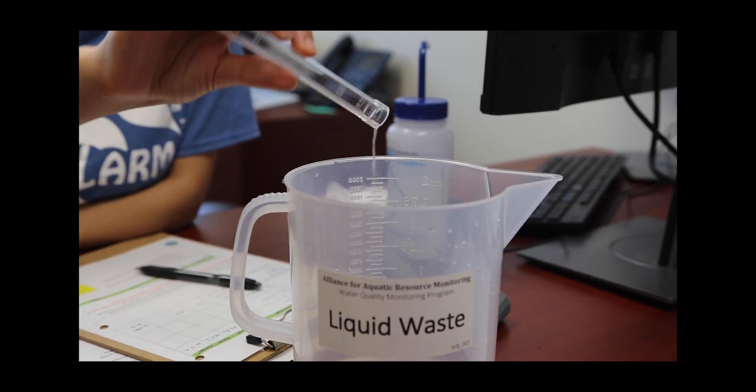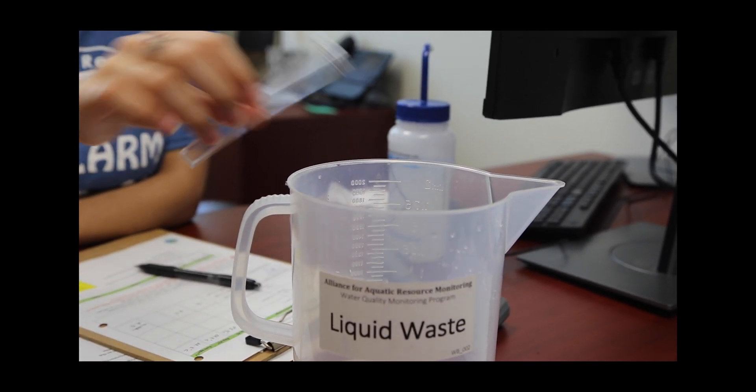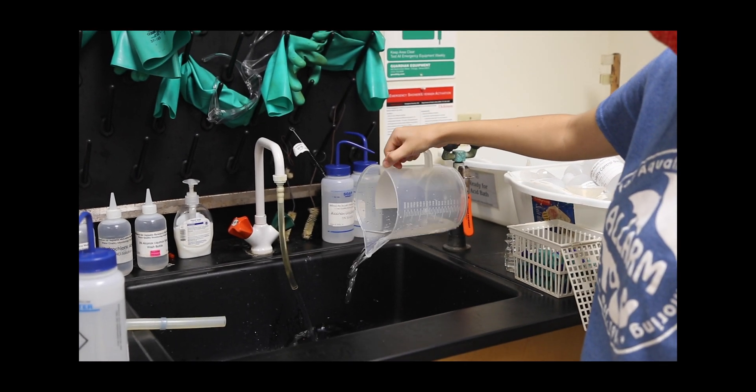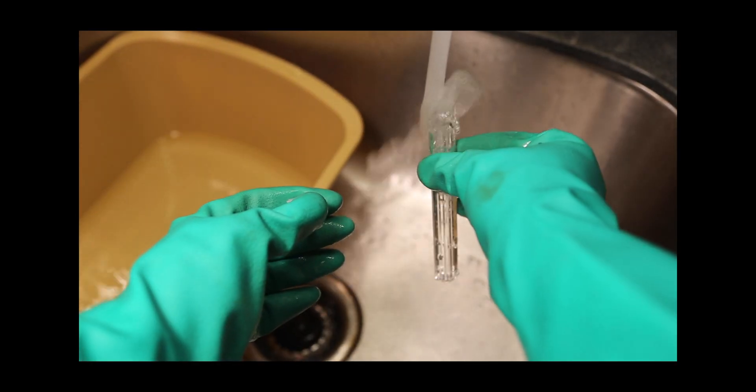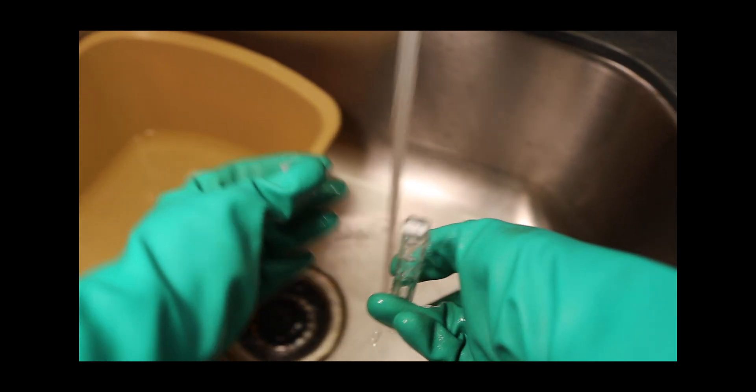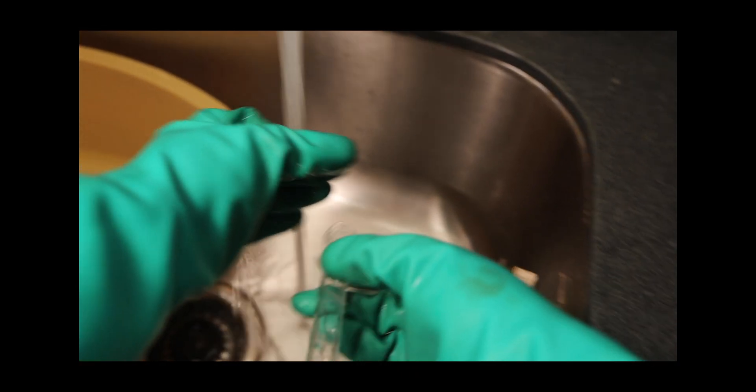When you are done, pour the water from both test tubes into your waste container or down the sink with running water. Next, be sure to wash your testing equipment accordingly. Check out our acid washing video to recall this procedure.